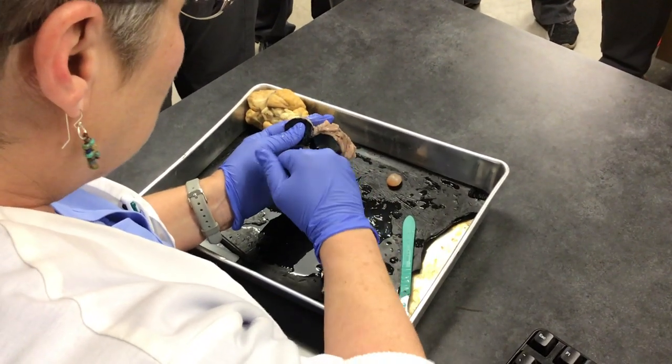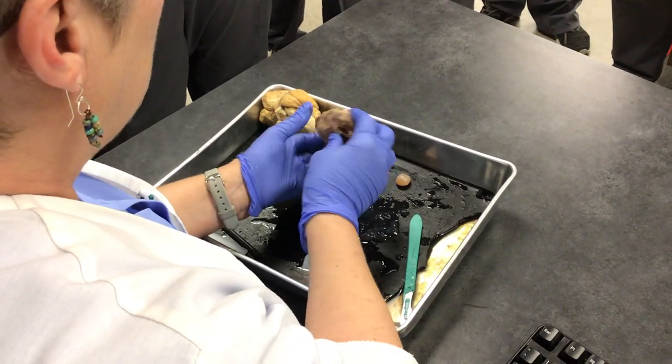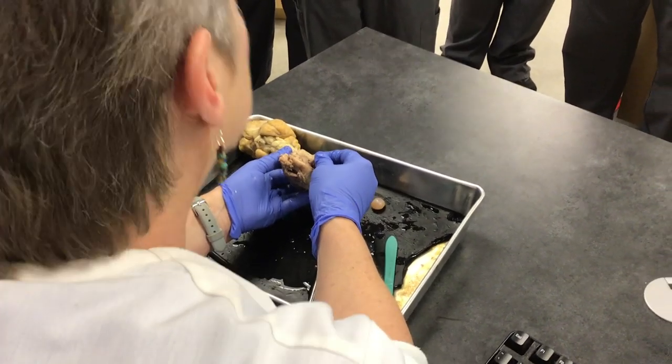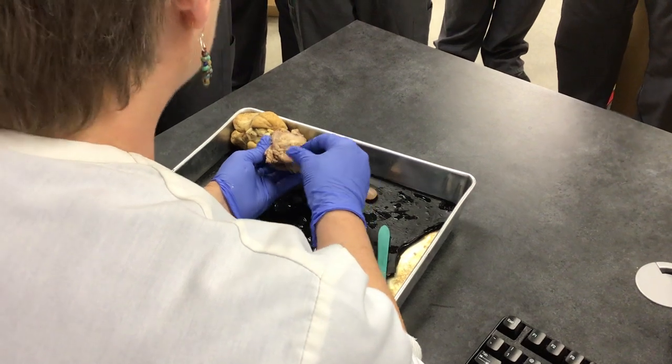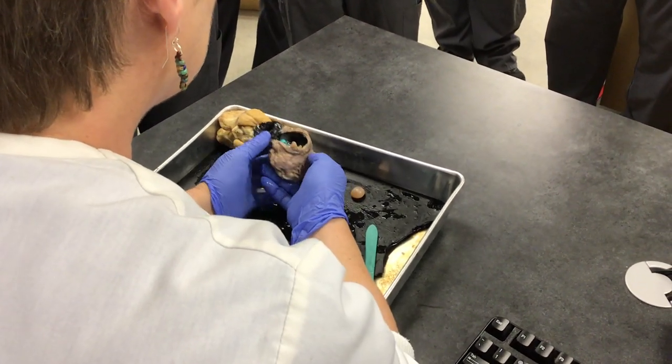So now I hope you can see — when the retina becomes detached, it affects the optic nerve, which means the person can't see. We have surgery now to correct it if it's not too severe, but if it's too severe, they will be blind.